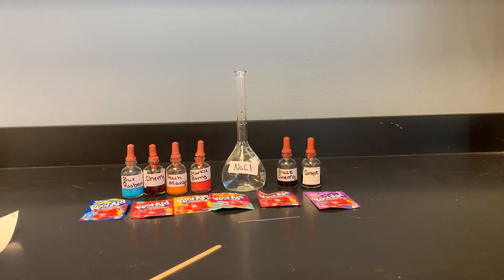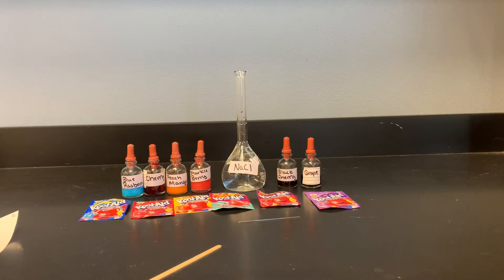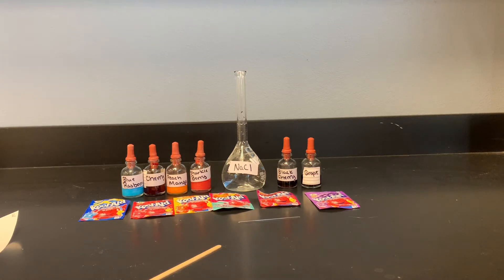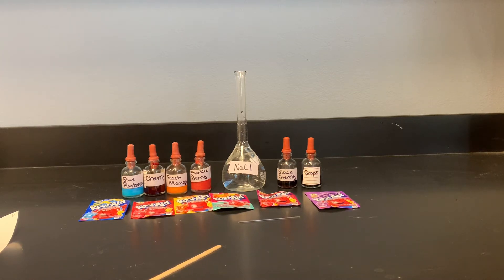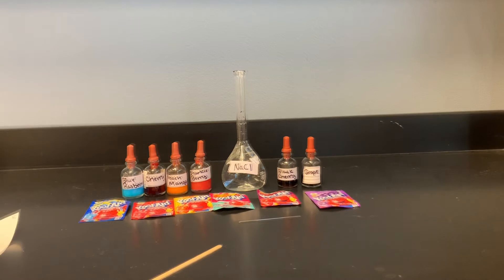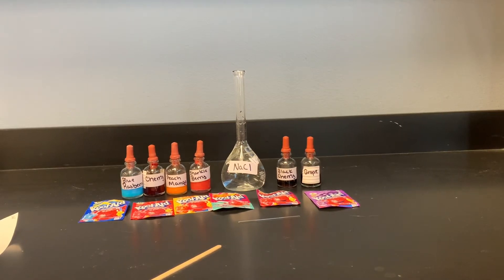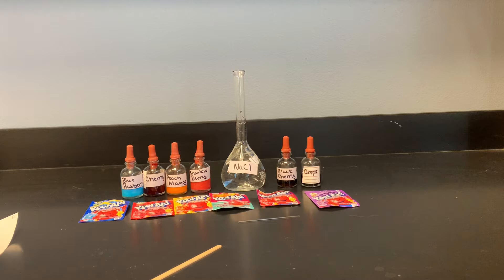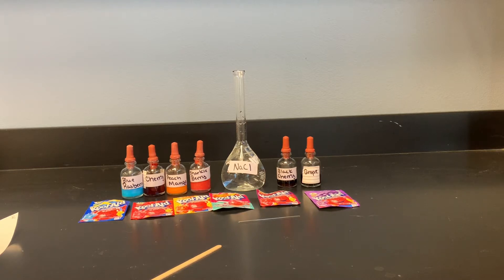We will be using paper chromatography to separate the food dyes in our mixtures. Paper chromatography works in two phases — liquid and solid — and is a straightforward process.